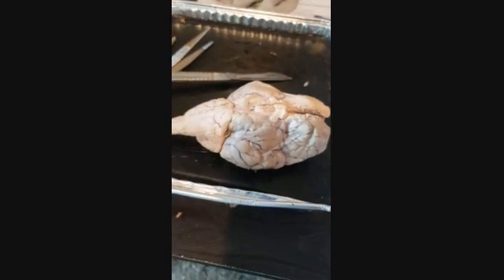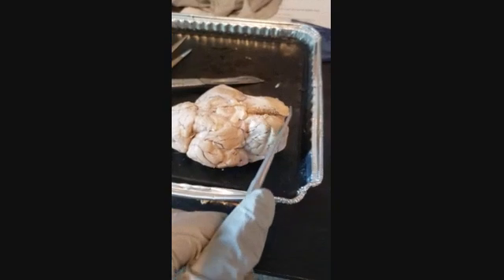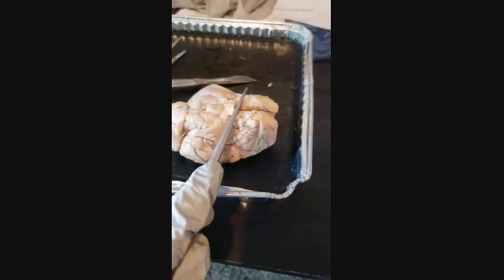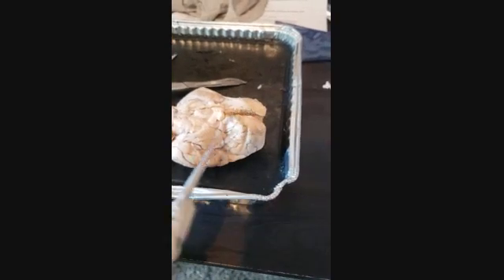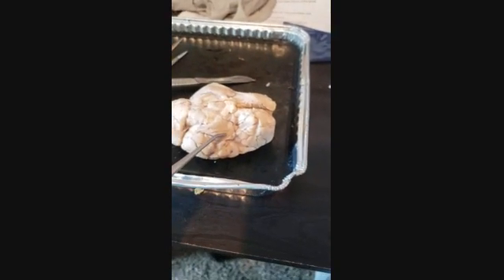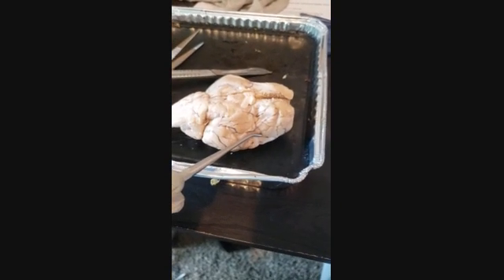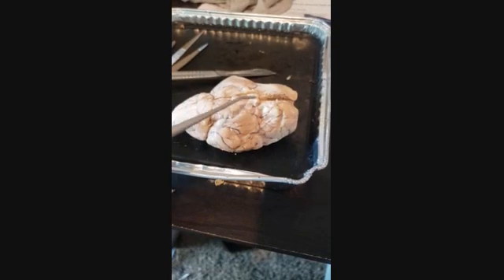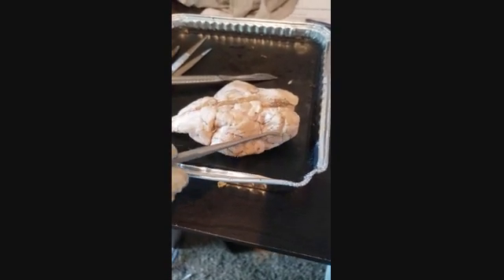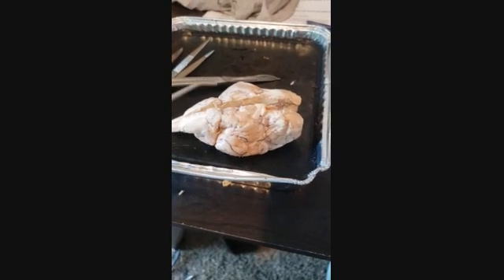This is the brain dissection video. This frontal area is the cerebrum. The cerebral cortex covers the cerebrum. There's also meninges, which are made of dura mater, pia mater, arachnoid mater. And those basically cover the clear lining, dense connective tissue that protects the central nervous system.